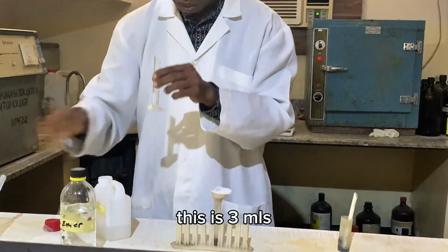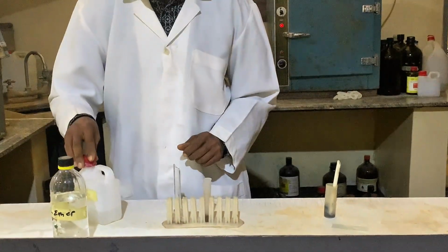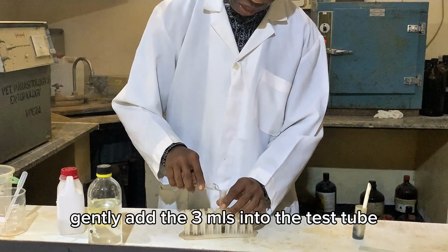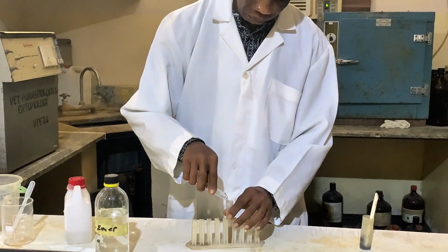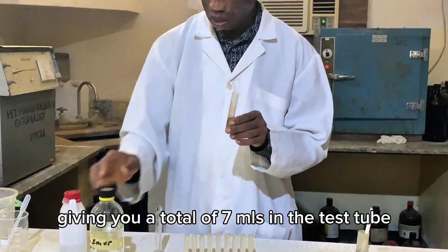This is 3 mils. Gently add the 3 mils into the test tube, giving you a total of 7 mils in the test tube.